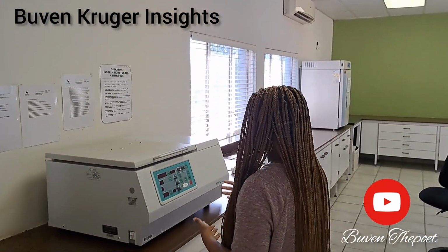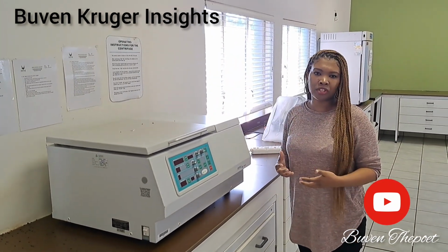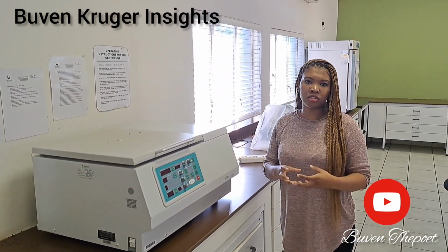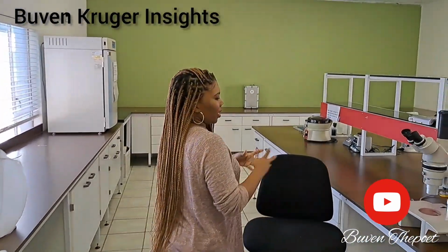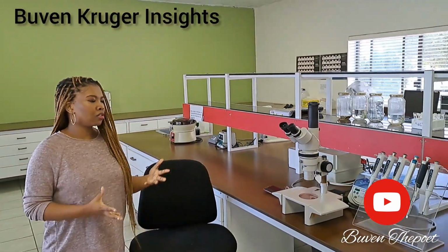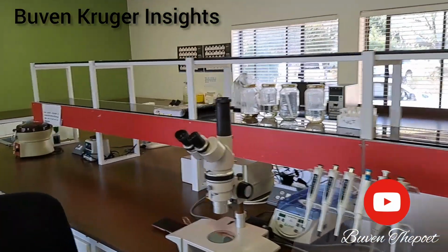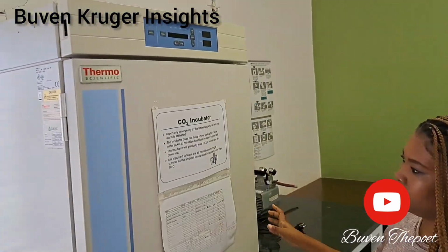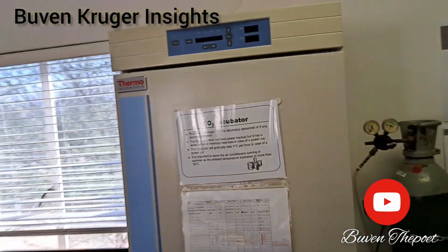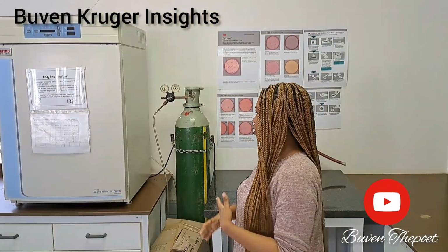And then this is a centrifuge. This is what scientists usually use to separate samples, like your mixtures, separate the liquids. We have a microscope also, and your pipettes. We have a CO2 incubator. Scientists usually use it to simulate certain types of environment that you want to create. This is what we use.